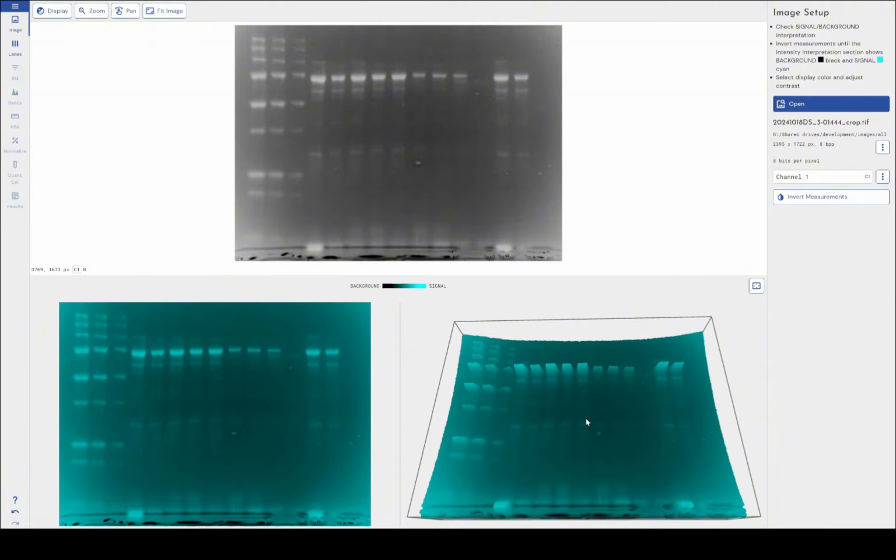What that means for me as an analyst is whatever background removal techniques I use for the lanes on the left-hand side are going to be very different in terms of strength and even possibly technique from those that I need to use in the center. And then on the right-hand side, those are going to be different. I'm going to need different parameters again.